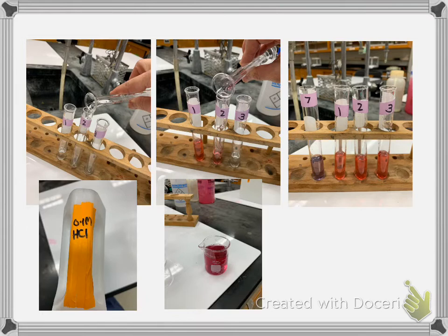So in the procedure, what it told me to do was, and this is on step 6, I'm on step 6. It said take 3 milliliters of hydrochloric acid, and this is also step 6.